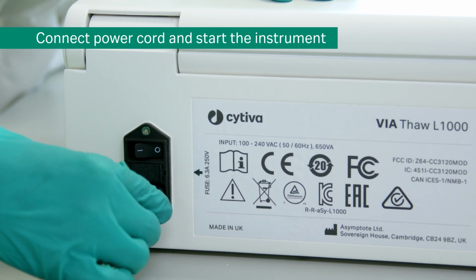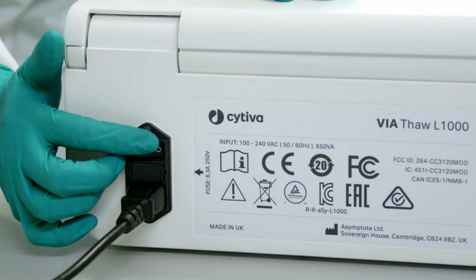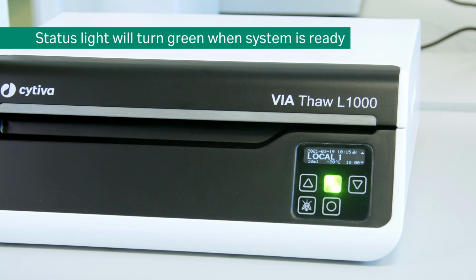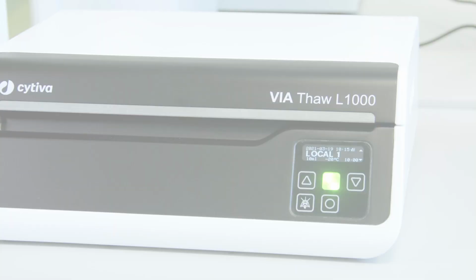Next, connect the main power supply cord and start the instrument. Move the power switch on the back to the on position. The unit will warm up. When at the correct temperature, the status indicator light on the control panel will turn green, and the startup screens will appear on the display.